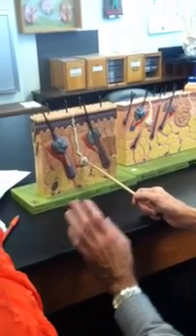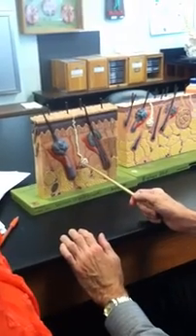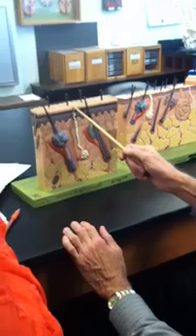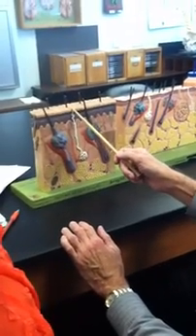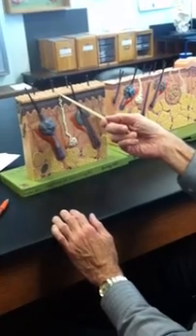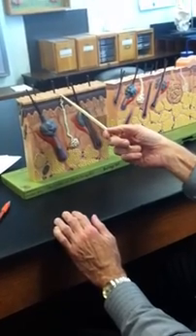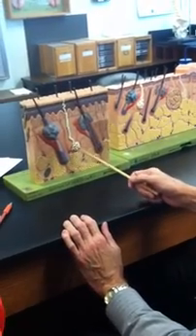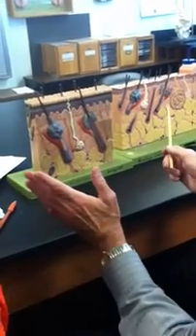Okay, that is a merocrine or eccrine sweat gland. How do you tell that that's this particular type of sweat gland? It has a duct that goes all the way to the surface, right there. So that's a pore in the skin, right there. Another key thing about this type of sweat gland, it is not associated with hair, not associated with follicles. It's its own independent organ.